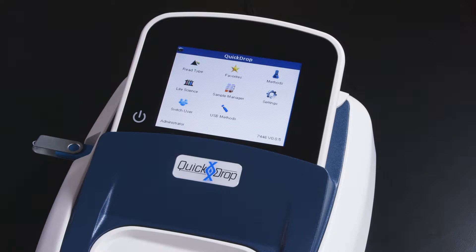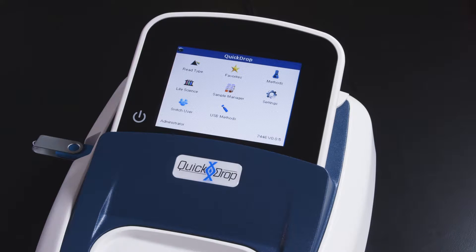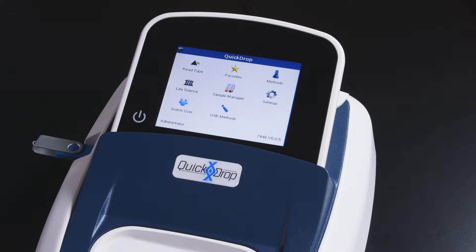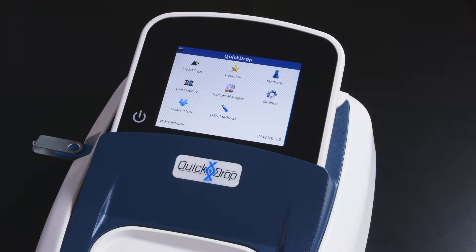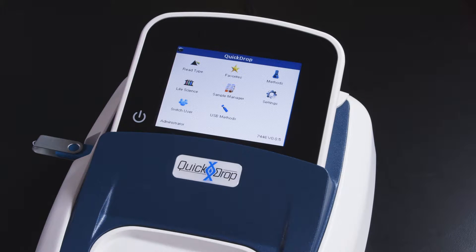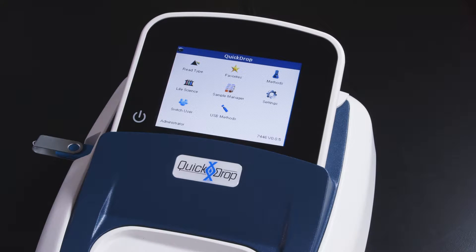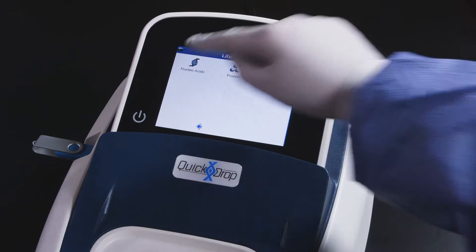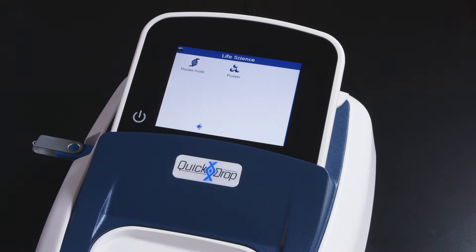The QuickDrop Microvolume spectrophotometer contains several pre-configured methods for quick nucleic acid and protein quantitation. To access the pre-configured methods, touch the life science icon on the main menu.